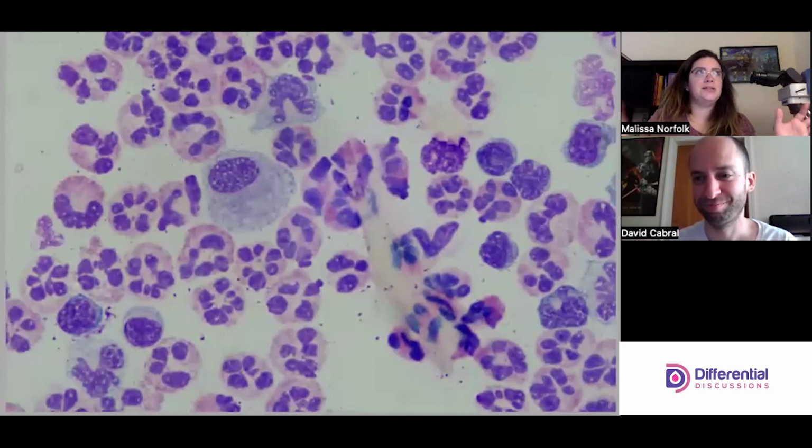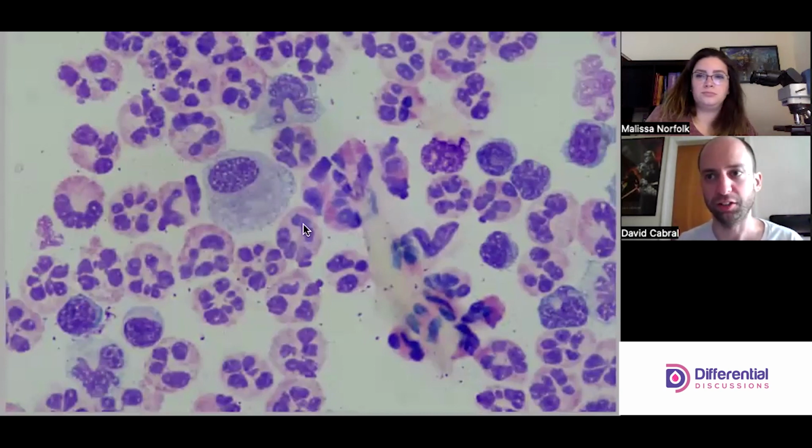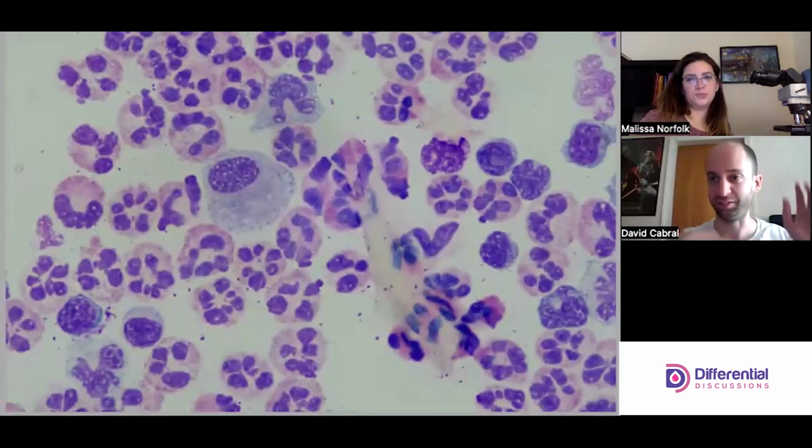Think about lining cells. Lining cells are lining the synovium, so they're connected. They're holding each other to maintain the lining. So when you're sloughing off those lining cells, you can see where they were connecting. Yes, those cells are tissue cells, and I know exactly what you're talking about. They'll have little bubbles, or there might be a fraying, as you described. And then this looks like a discrete cell, nice and neat and clean on the edges. So probably an easy mono call.